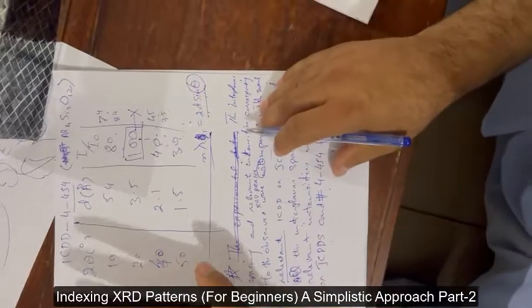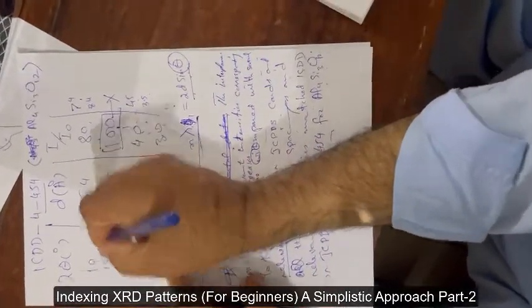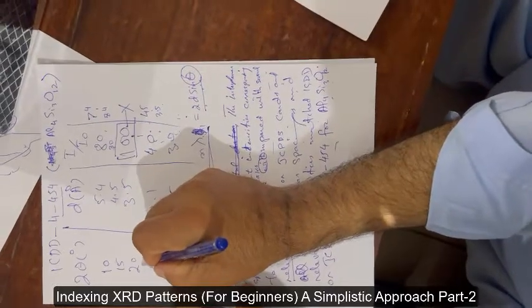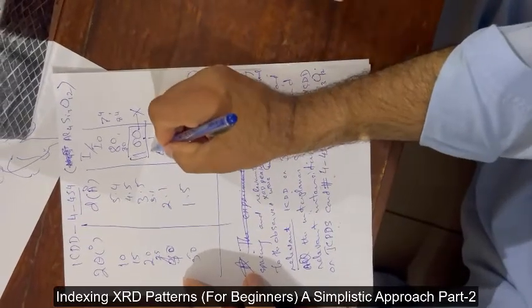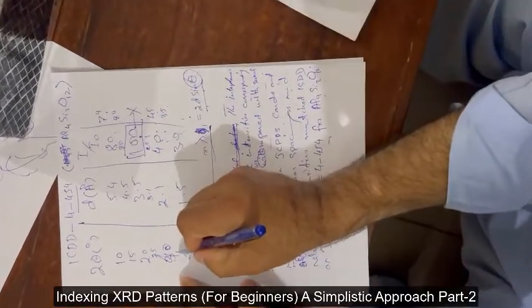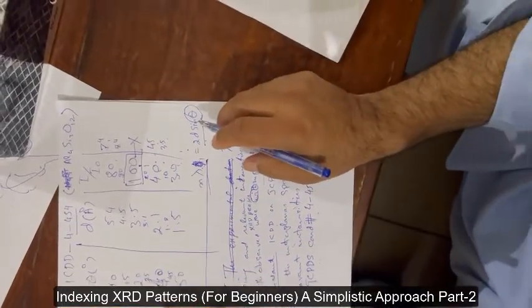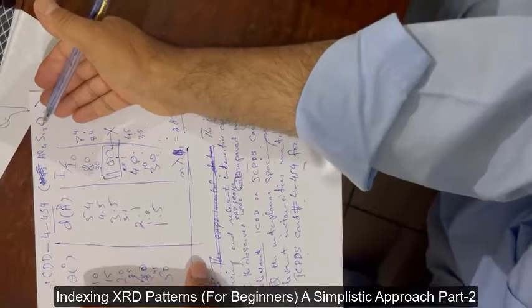This is the ideal case when all the peaks are matching. If some peaks are not matching — for example, at 15° there is a peak with d = 4.5 Å and intensity 30, another peak at 25° with d = 3.1 Å and intensity 20, and another at 45° with d = 1.8 Å and intensity 10 — then you will need to look for relevant additional phases.